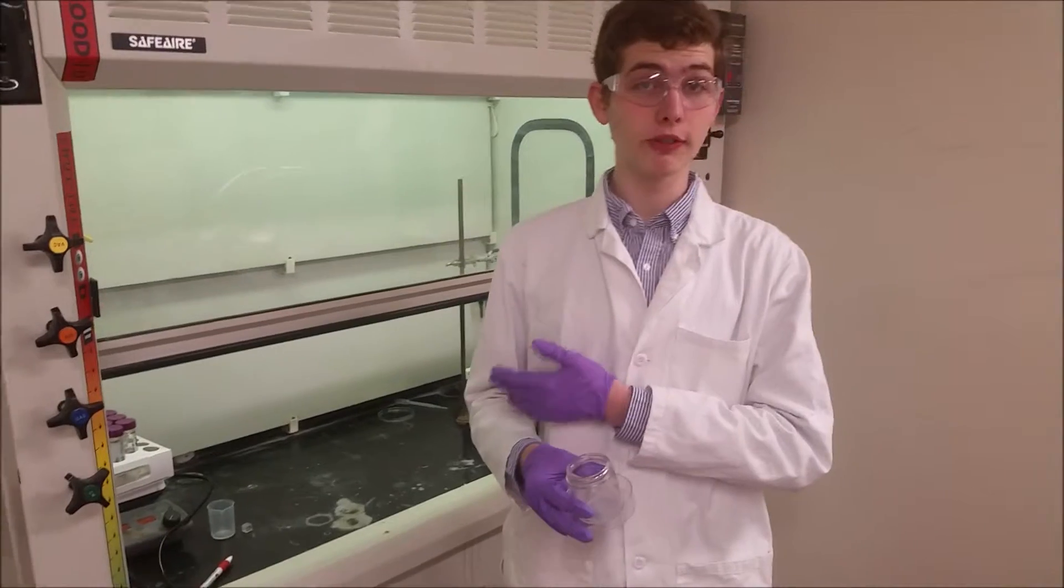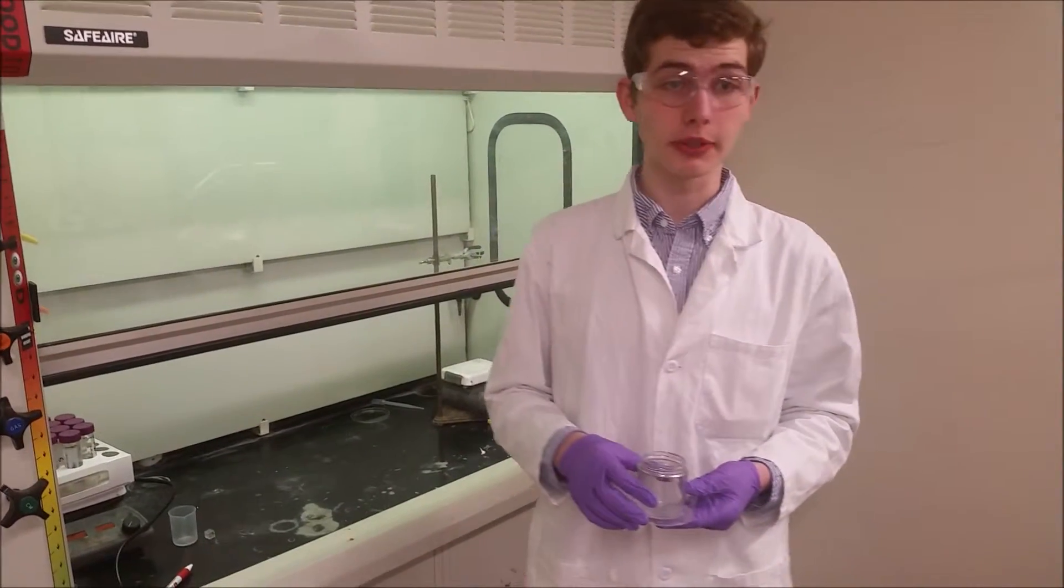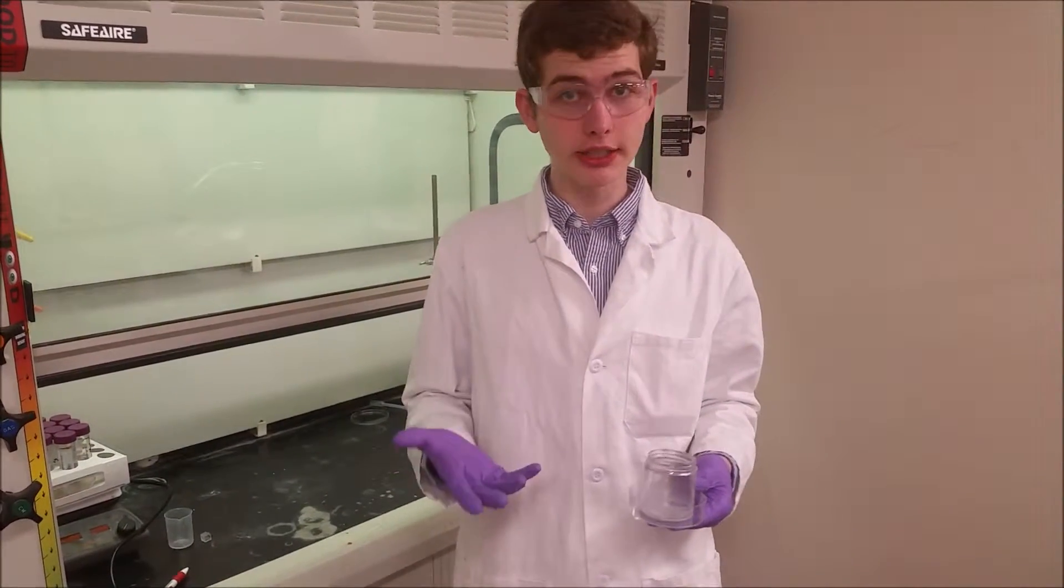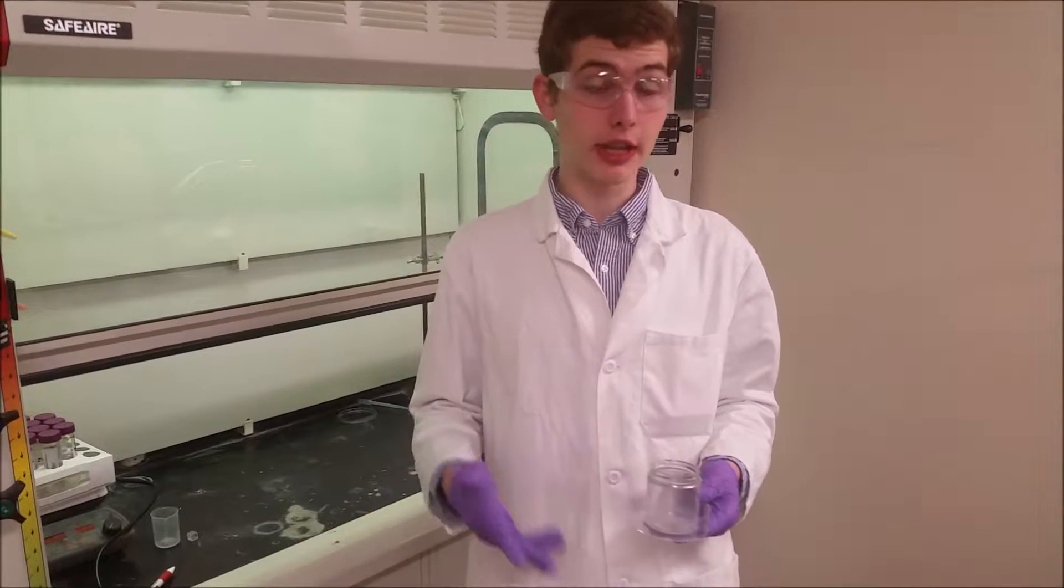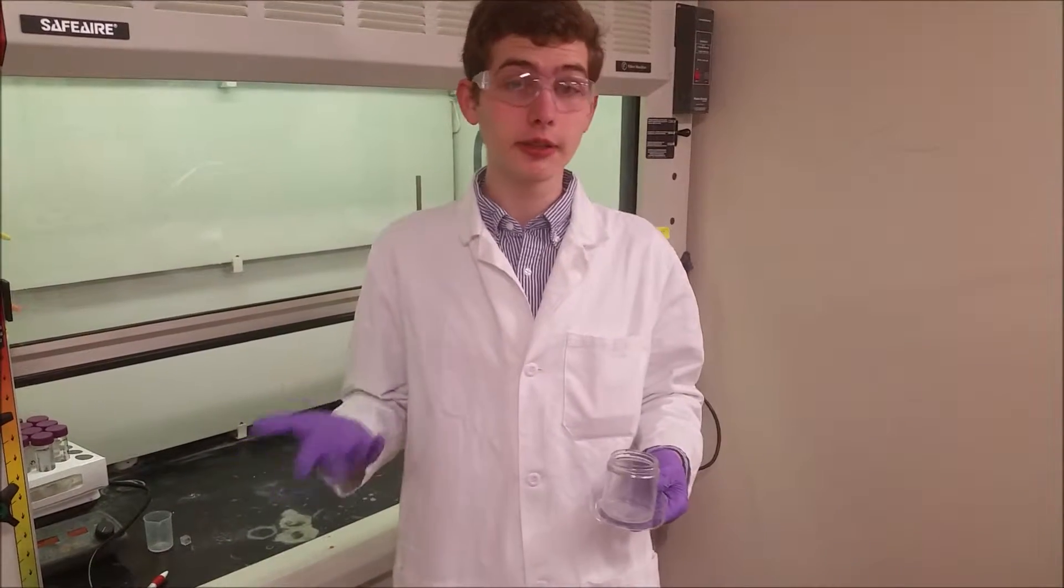Behind me right now is a chemical fume hood, and that's because we're going to be working with two very toxic materials that produce two very toxic products.